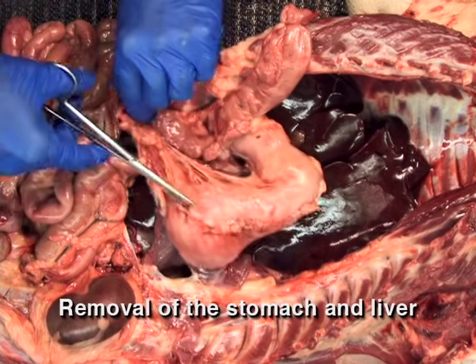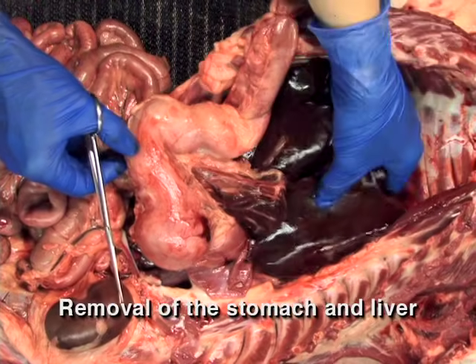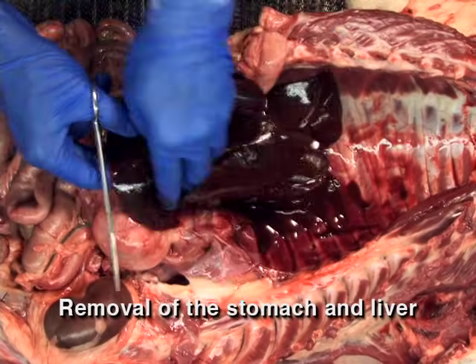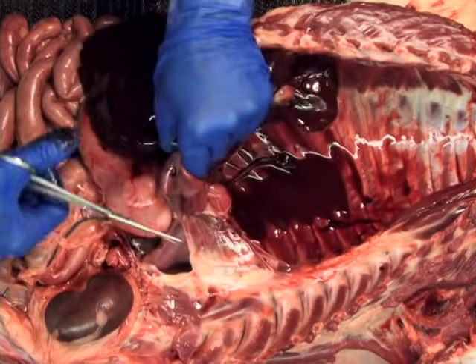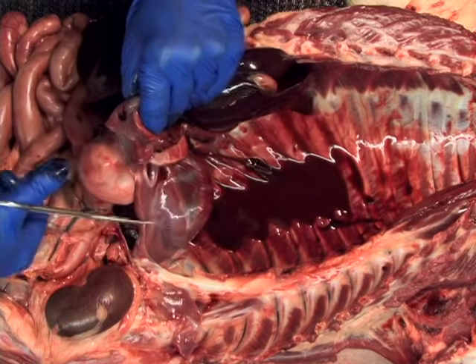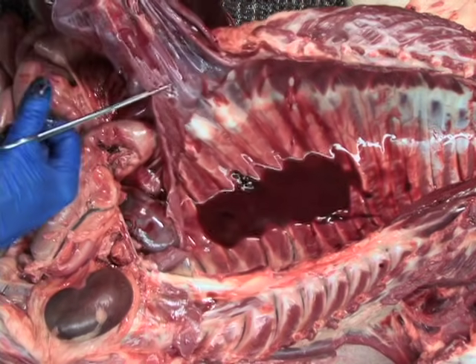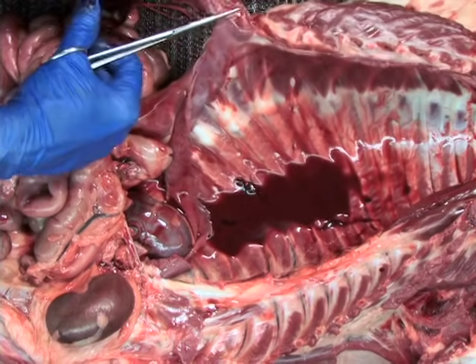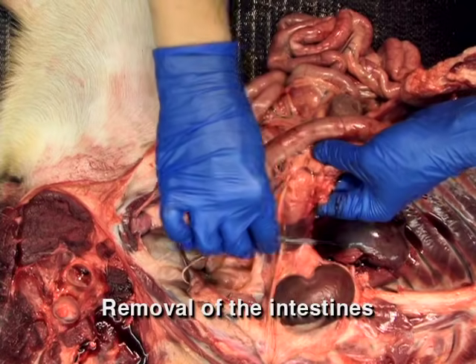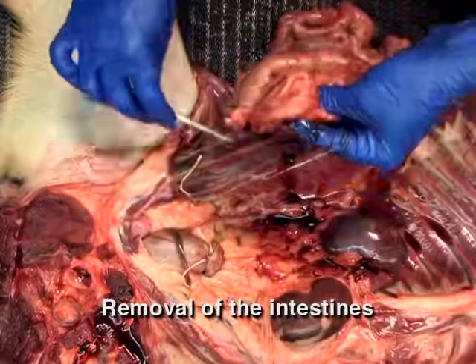In this approach, first incise between the two duodenal ligatures placed previously, then sever the mesenteric attachments of the duodenum and stomach, and finally remove them together with the liver and attached diaphragm as one unit. After that, incise between the two ligatures placed on the rectum and remove the small and large intestines as a unit by cutting through the root of the mesentery.